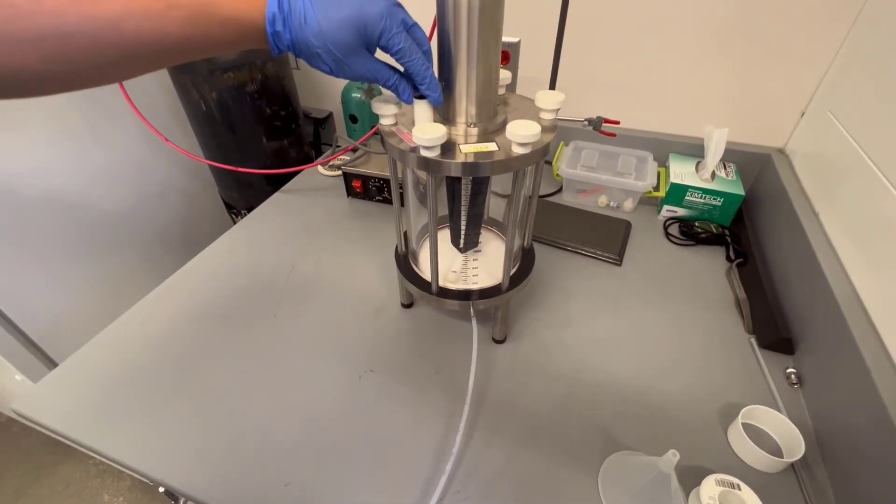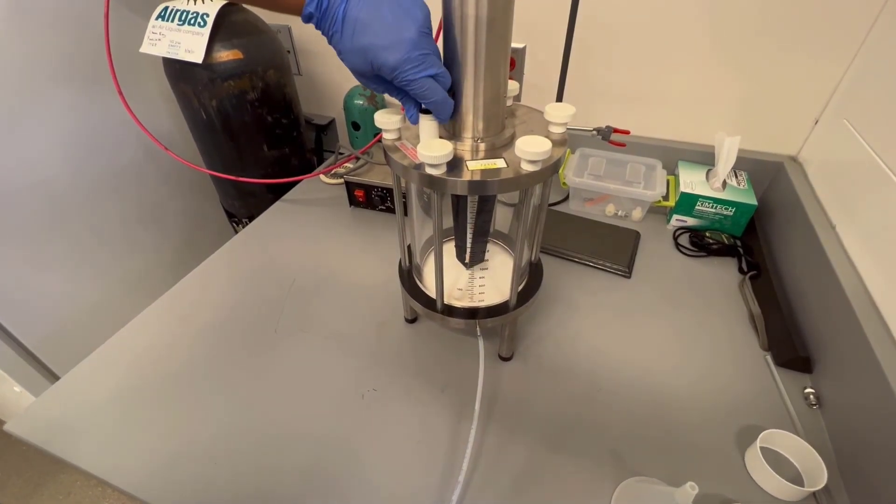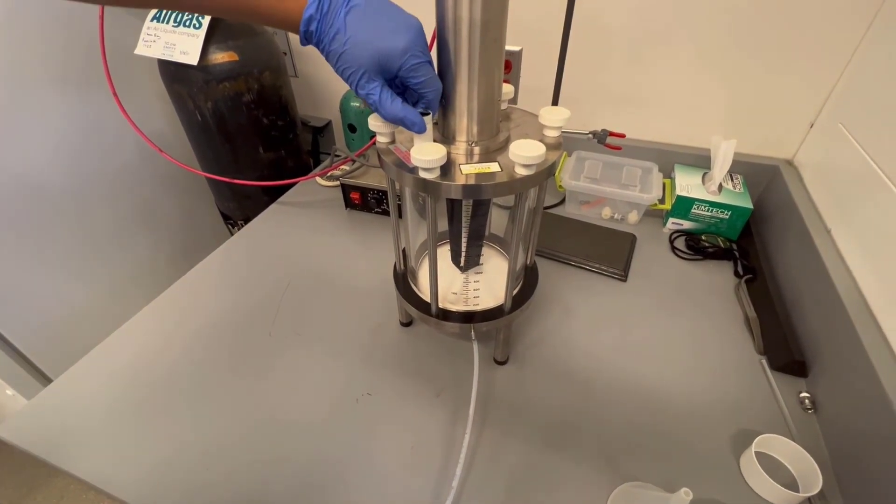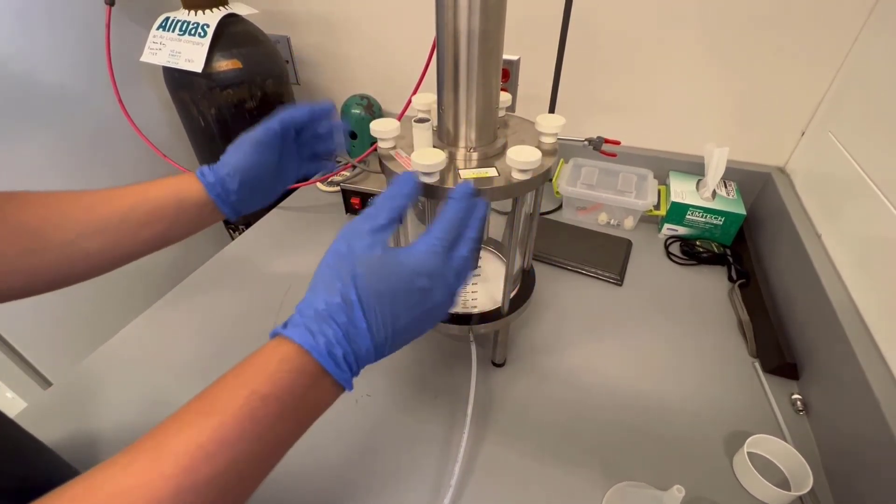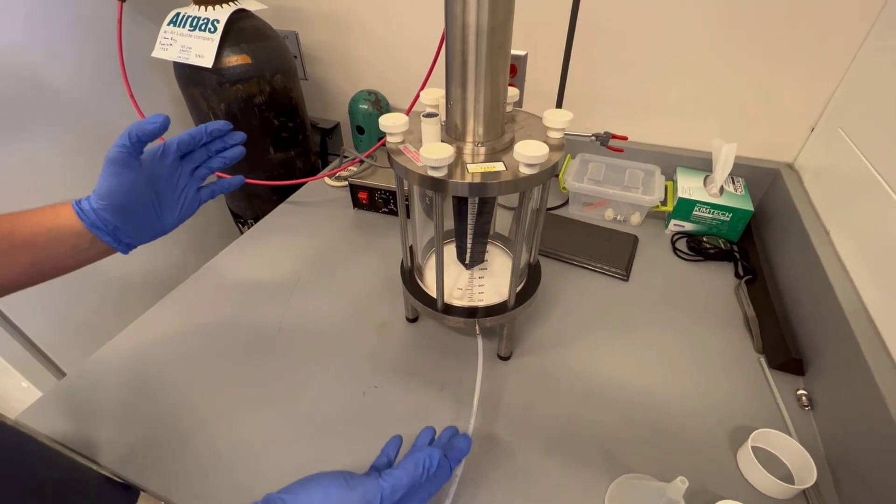The other important thing is that after your process is fully completed, you'll want to twist this. It's a pressure relief valve. All the stored up gas that's causing a high pressure in there will release through there so that you can take everything out and reset up your system.